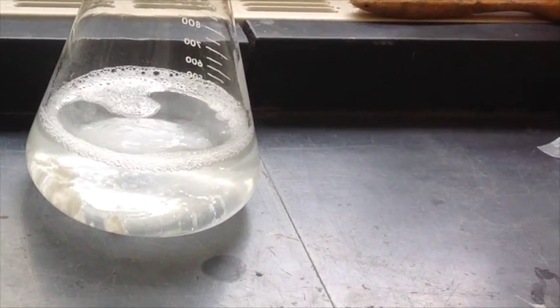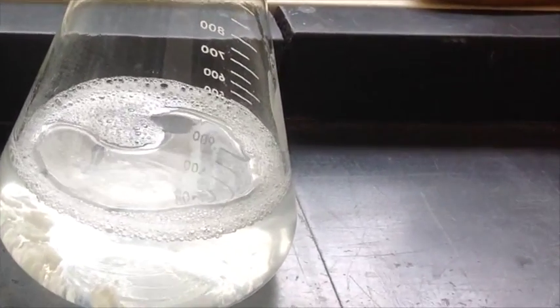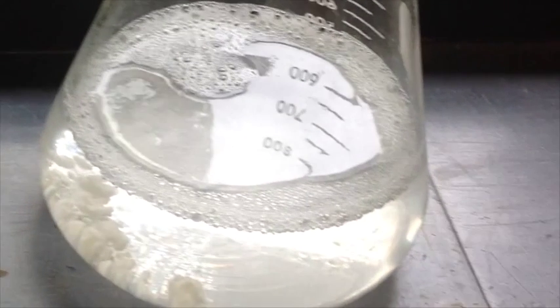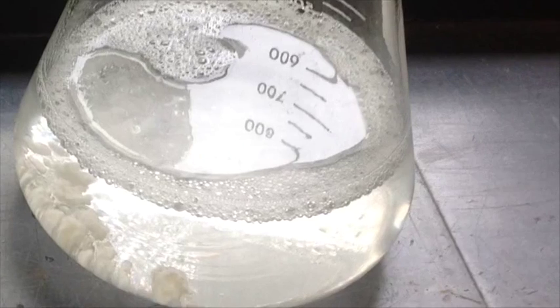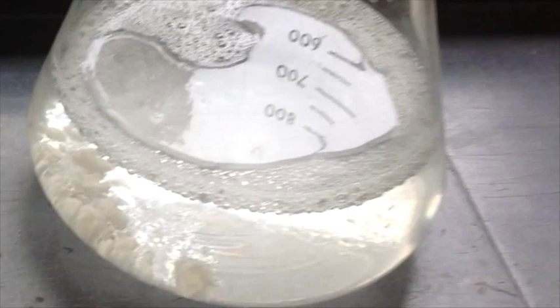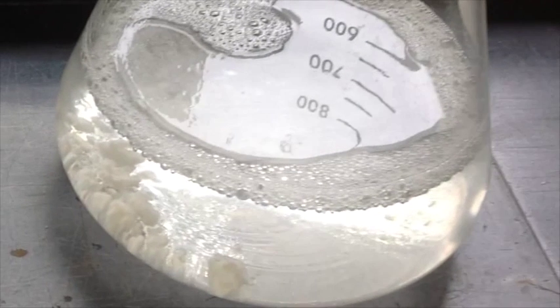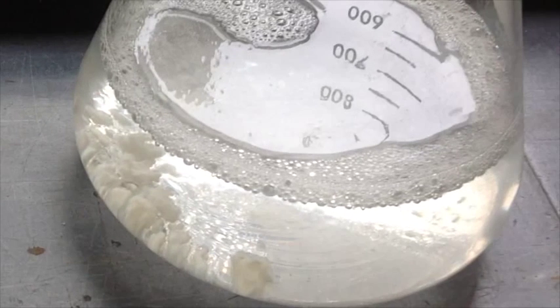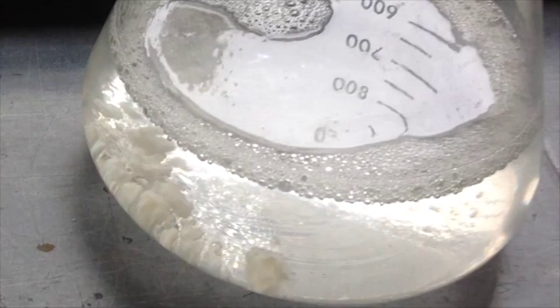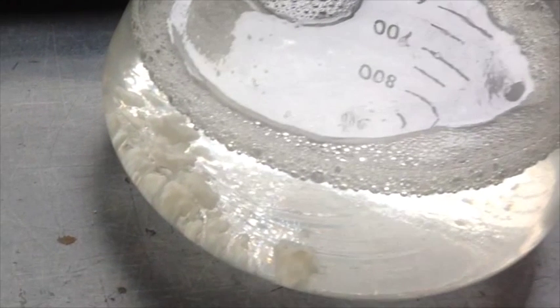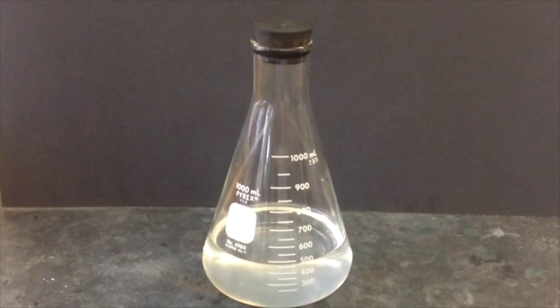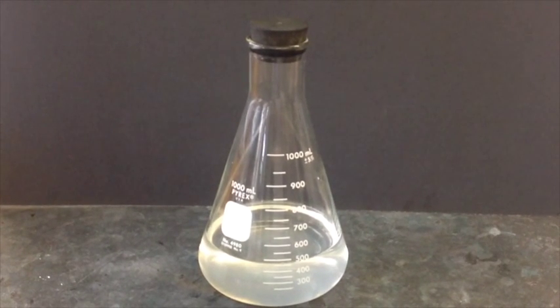If you look closely at the flask, you can see that the NaOH solid has dissolved, but the casein has not. And if you look even closer, you can see a clear gel forming around the casein, which is the NaOH dissolving the casein into the solution. Here is the completely dissolved casein solution ready for use.